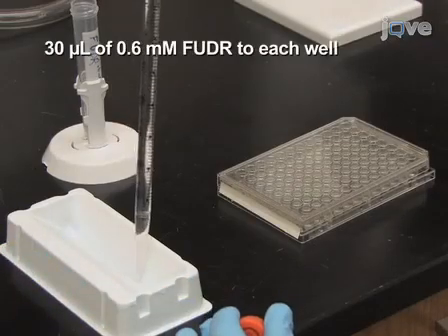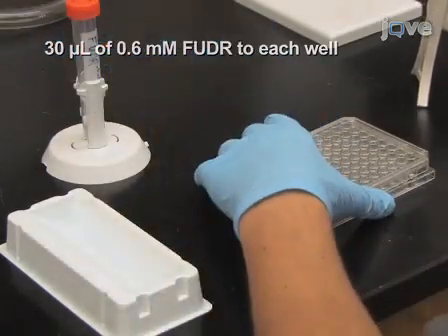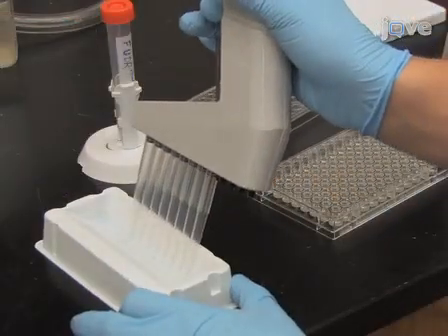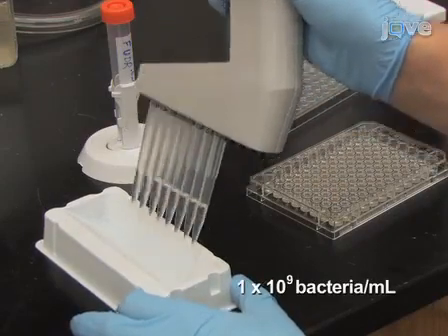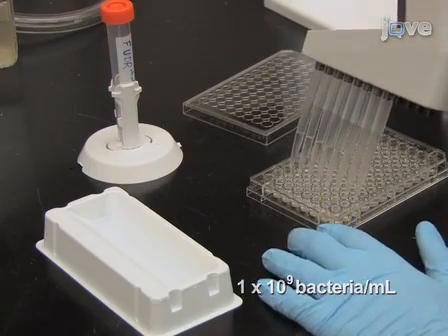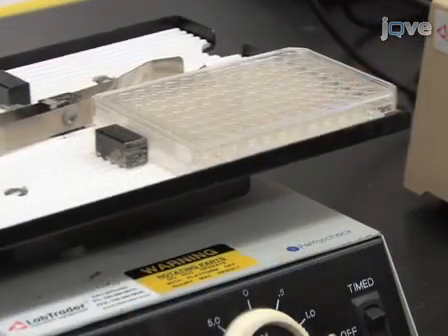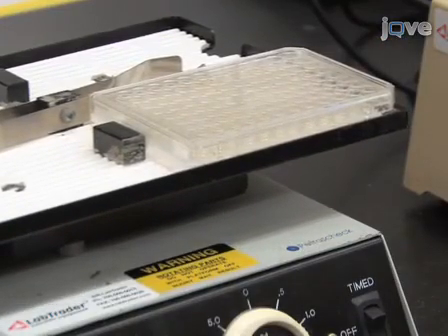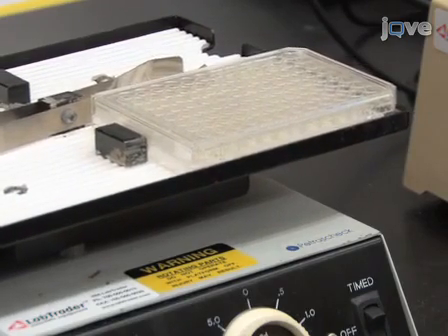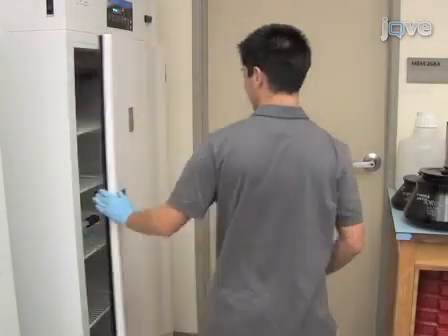Next, to sterilize the animals, add 30 microliters of a 0.6 millimolar FUDR stock solution to each well. This step brings the final volume in each well to 150 microliters and reduces the final concentration of OP50 from 6 mg per milliliter to 5 mg per milliliter. Seal the plate using tape sealers and shake it for 2 to 3 minutes on a microtiter plate shaker. If the OP50 was added at 2:30 on day -2, it is important that the FUDR is added before noon. Return plates to the 20 degrees Celsius incubator.